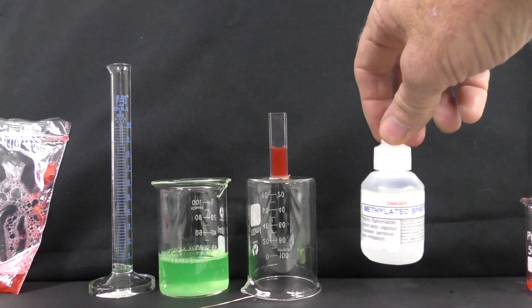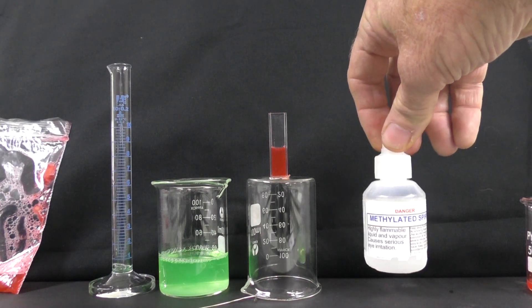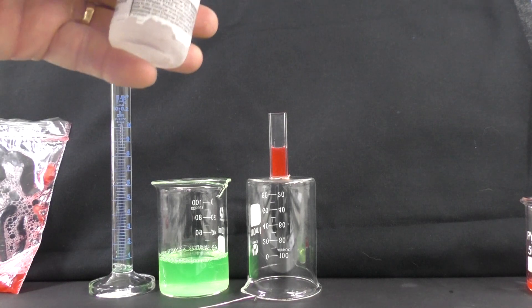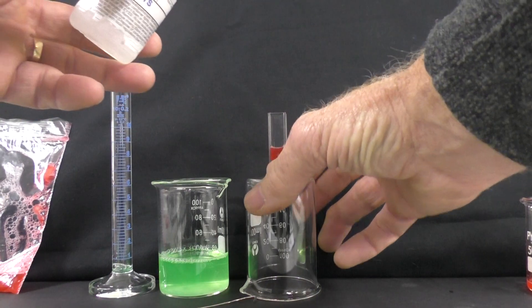Into this we're going to run some methylated spirits. We're going to run it down the side so that hopefully we get a nice layer of methylated spirits sitting on the top.